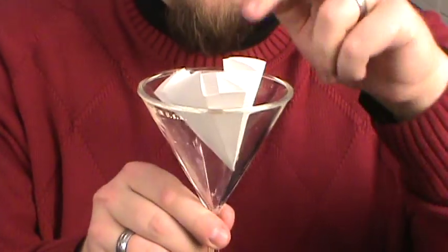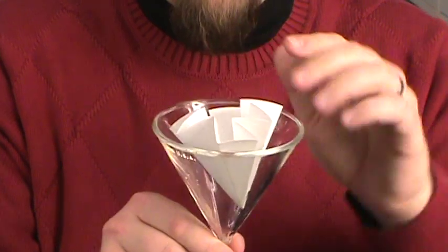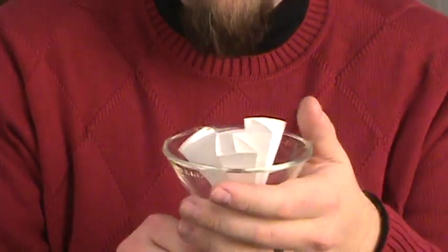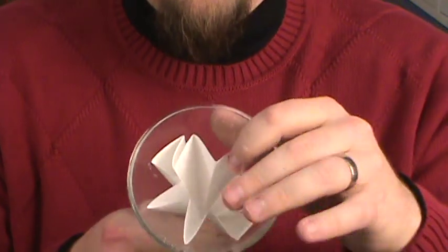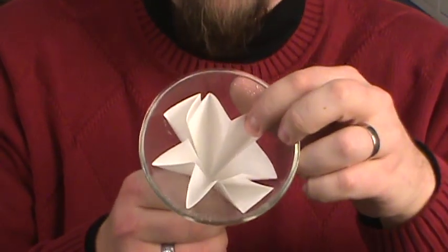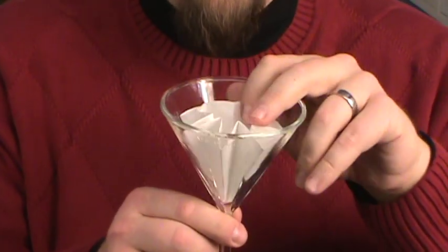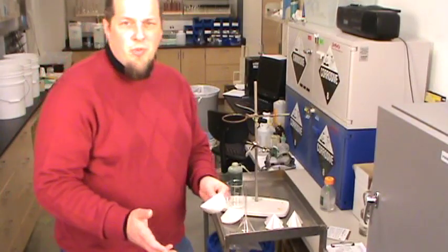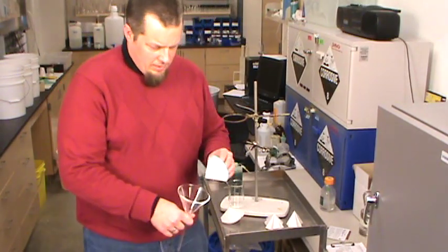As soon as you've got some water in there, as soon as you've got some liquid in there, it'll sit down a little bit more. So again, what's the point of a flute versus a flat? A fluted filter paper, you see there's a lot more surface area, so if you have something that filters pretty slowly this usually works a little bit better. So once we've got the filter paper folded, now we come to the next step.